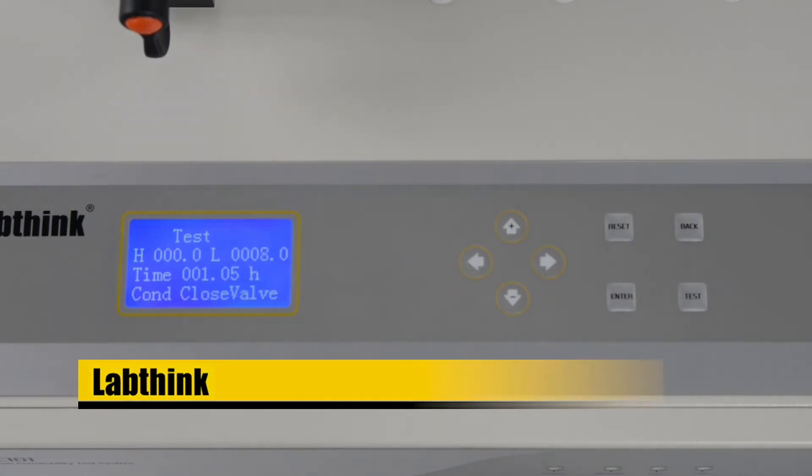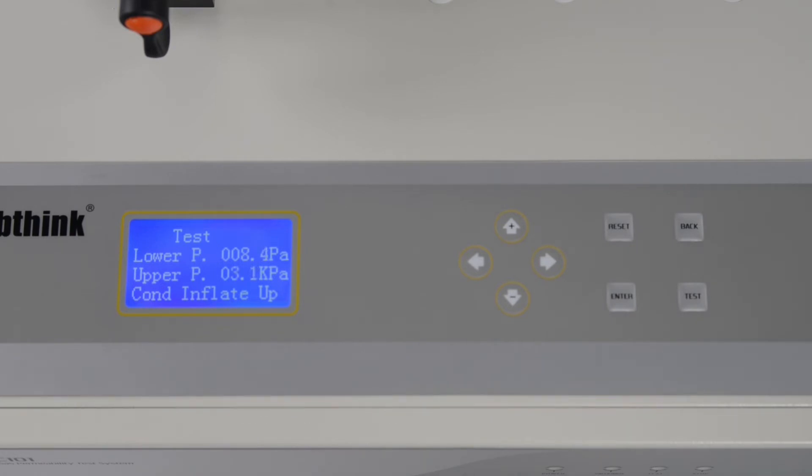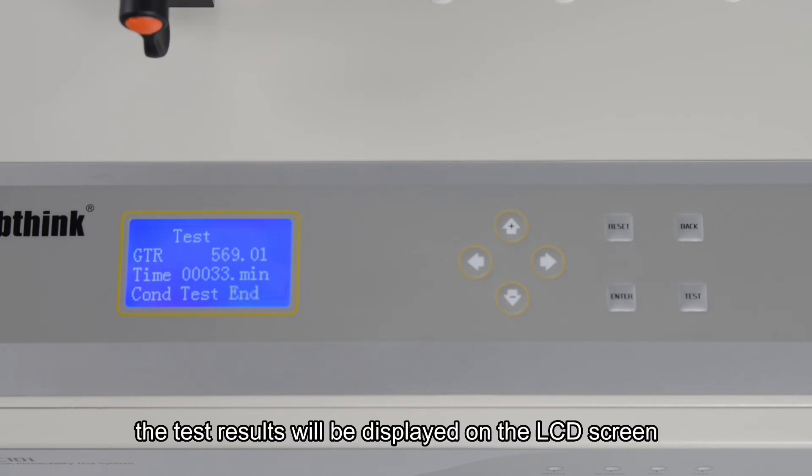Step 4: Initialize the test. Simply press test key to start the test. Under automatic mode, the test will automatically end. When the test is finished, the testing results will be displayed on the LCD screen.